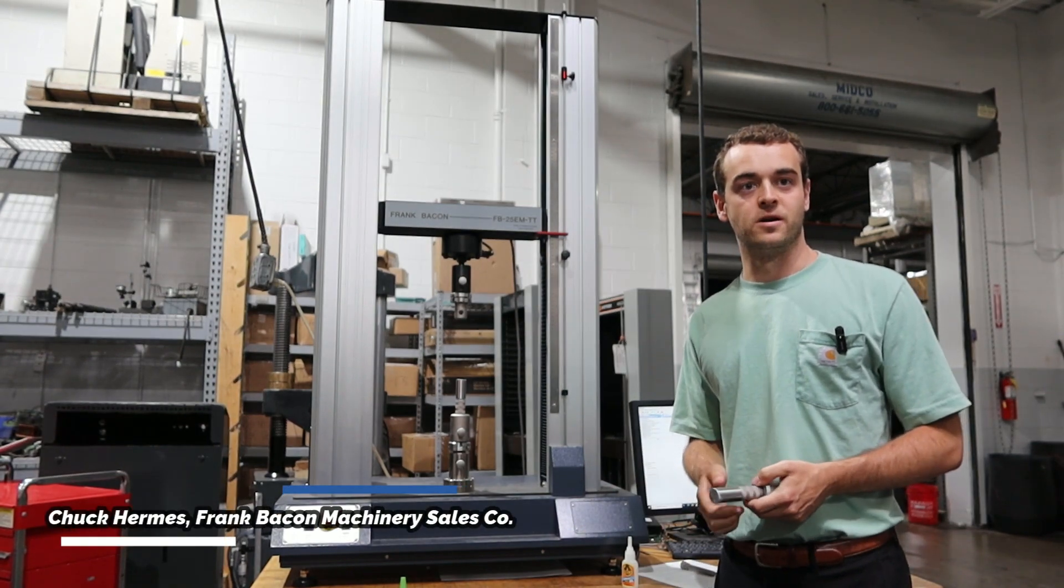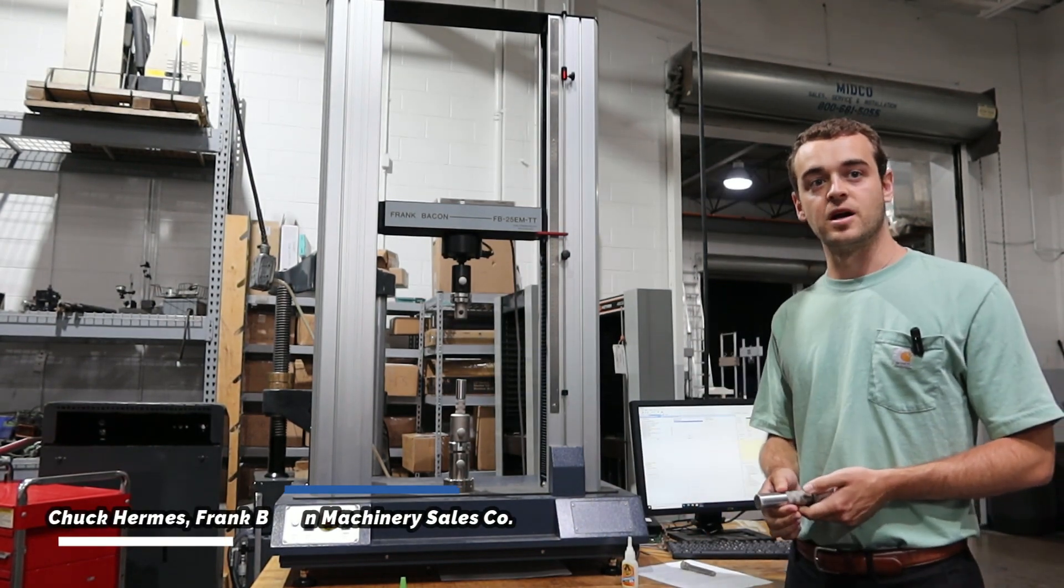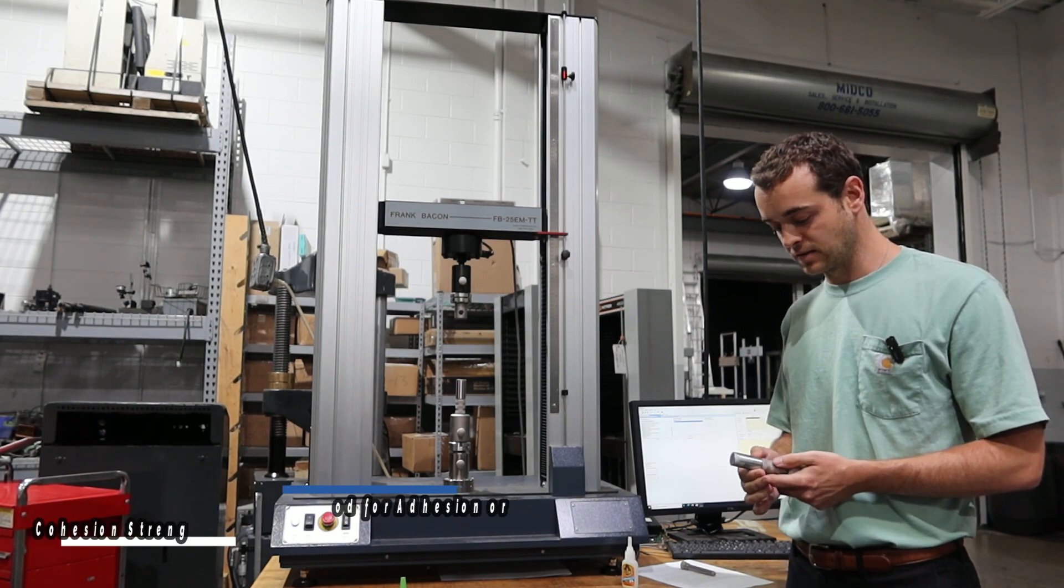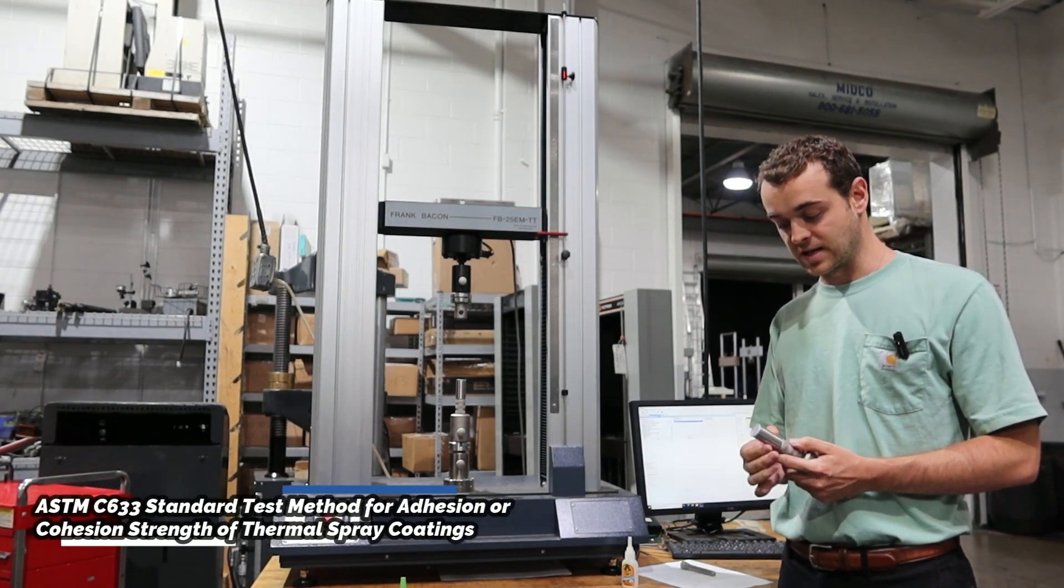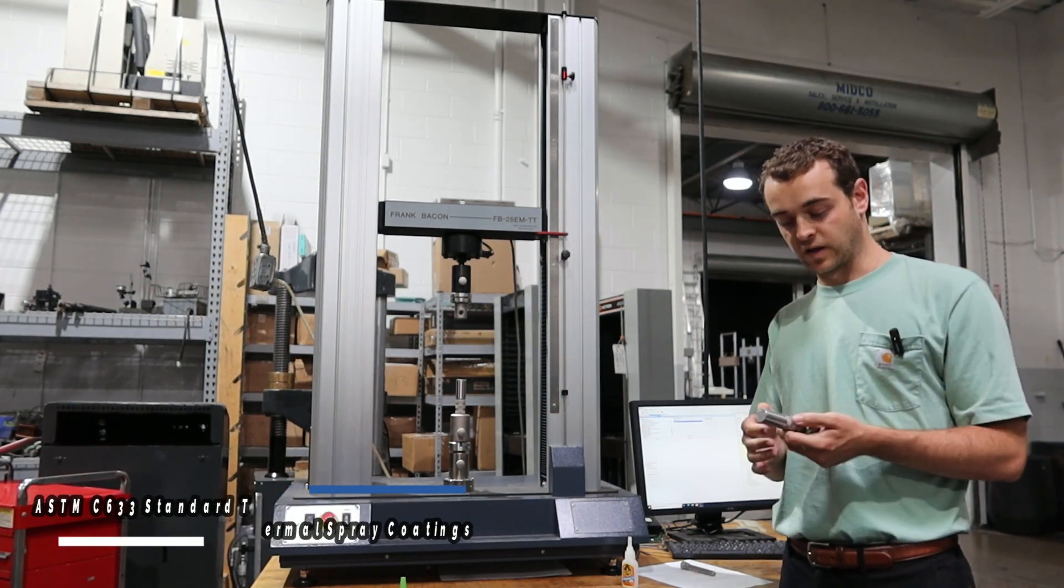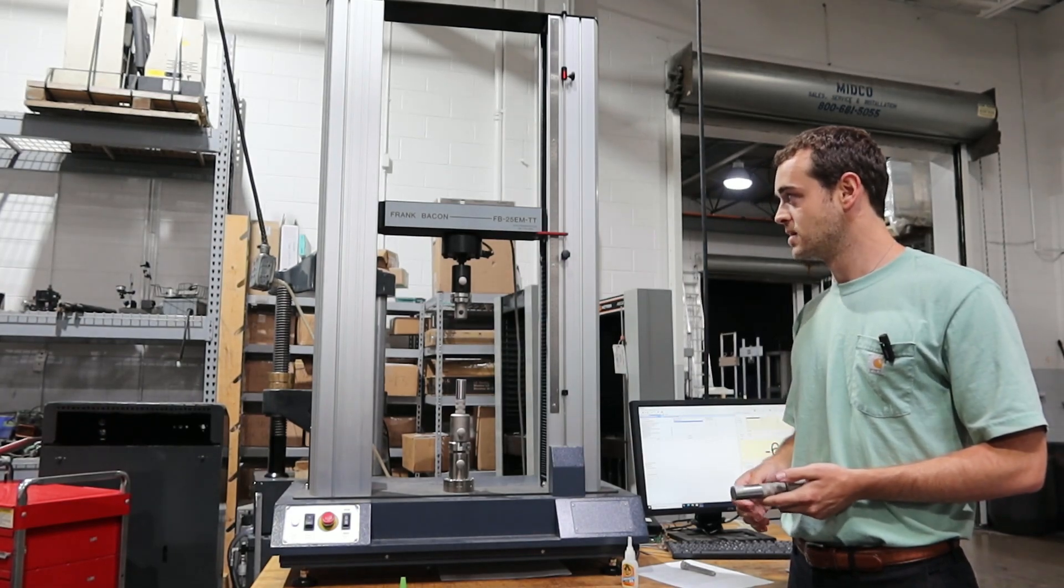Everyone, Chuck here with Frank Bacon Machinery, here to show you some ASTM C633 testing, thermal spray coating testing. Show you the fixture here and we'll go ahead and actually run a test as well.